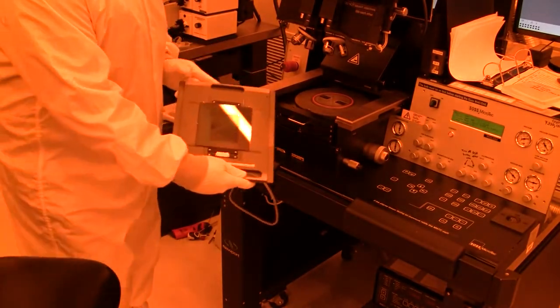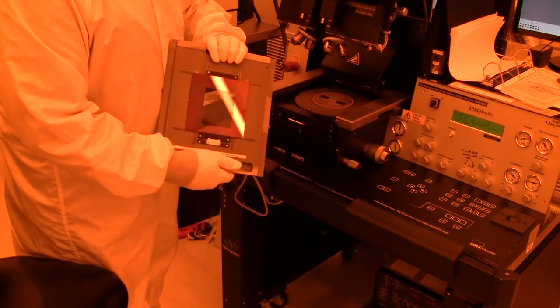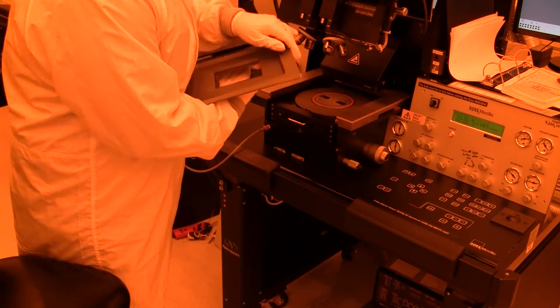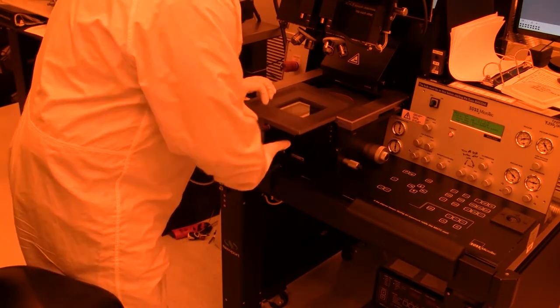So now the mask is held in there and I can flip it over. Oh wait, always put your hand in front of it in case the vacuum fails. So I flip it over, I slide it into our Süss mask aligner.